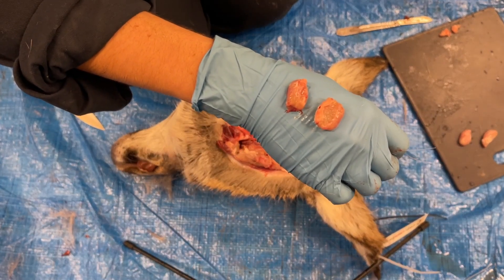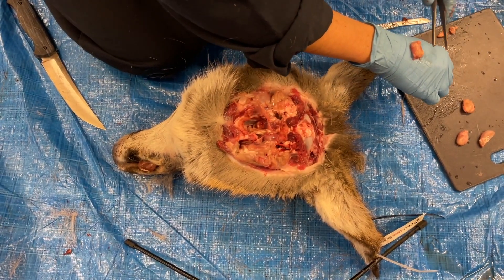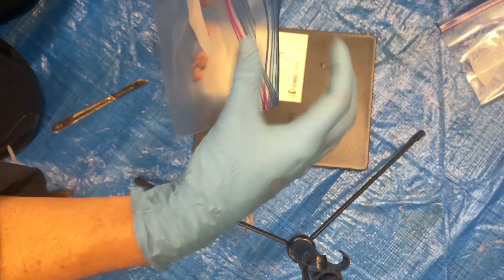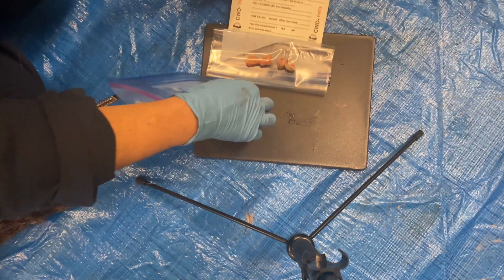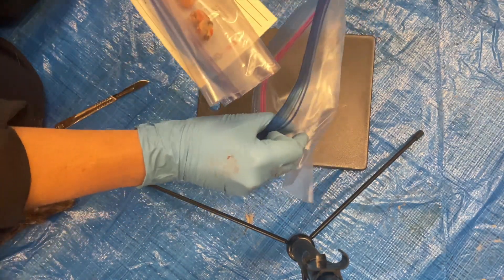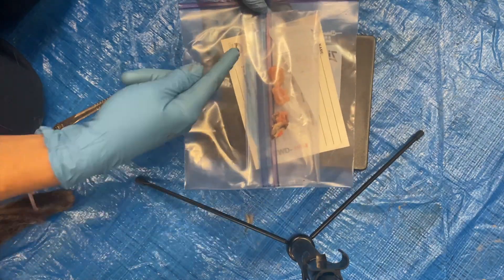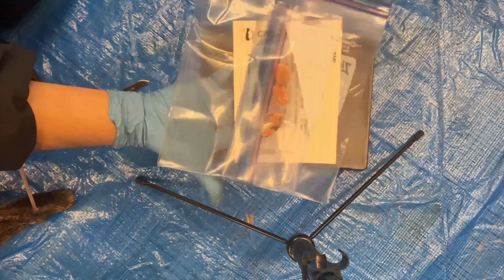The tonsils have been successfully removed and are now ready to be submitted for chronic wasting disease testing. Place the tonsils and lymph nodes in a zip-lock bag. Wrap them up with a completed ear card and put it in a second zip-lock bag. Seal it up and drop it off at one of the freezer locations. The number on your card is what you use to look up results, so remember to take a photo of the card or record the number.